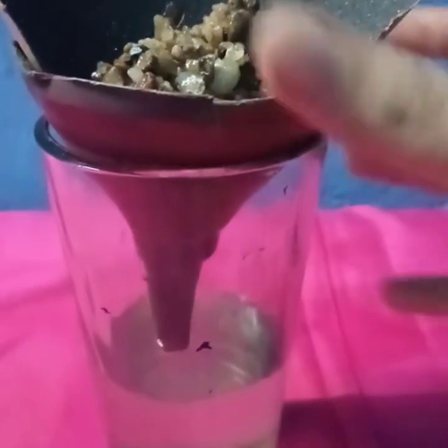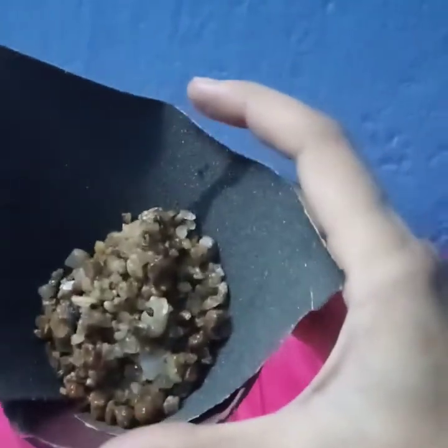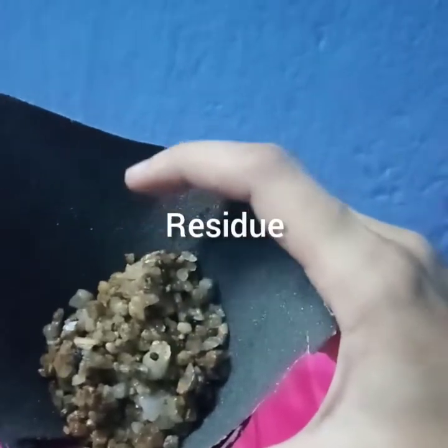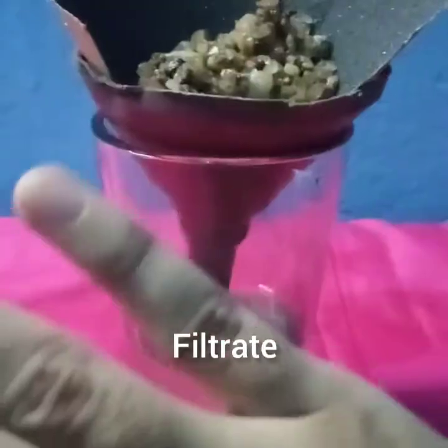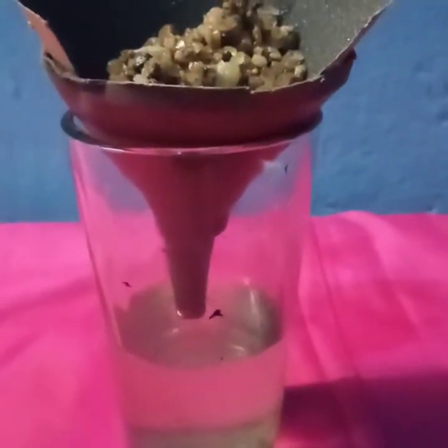Water is here and sand is here. This is called the filtrate and this is called the residue. You can see here in this filter paper, this is the residue and this is the filtrate. So this is the observation of separating sand from water by the process called filtration.